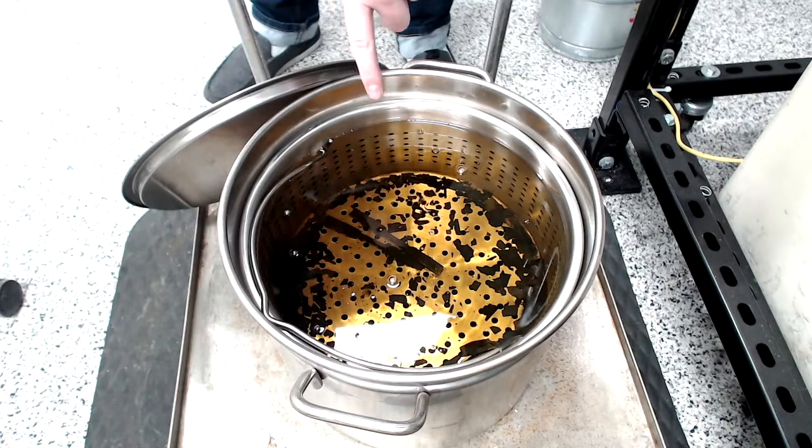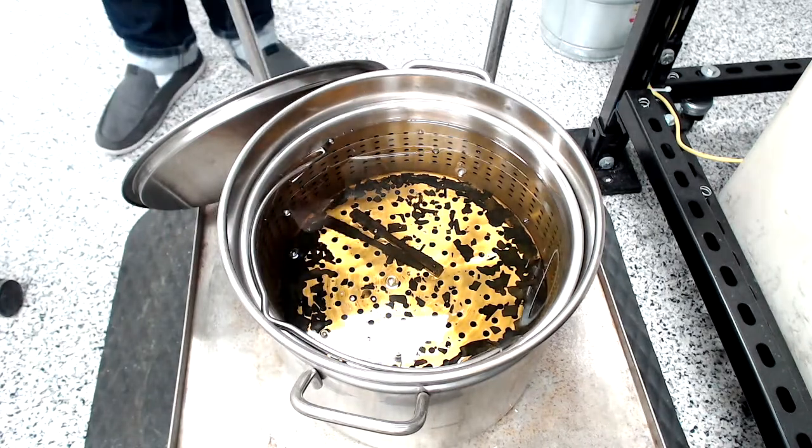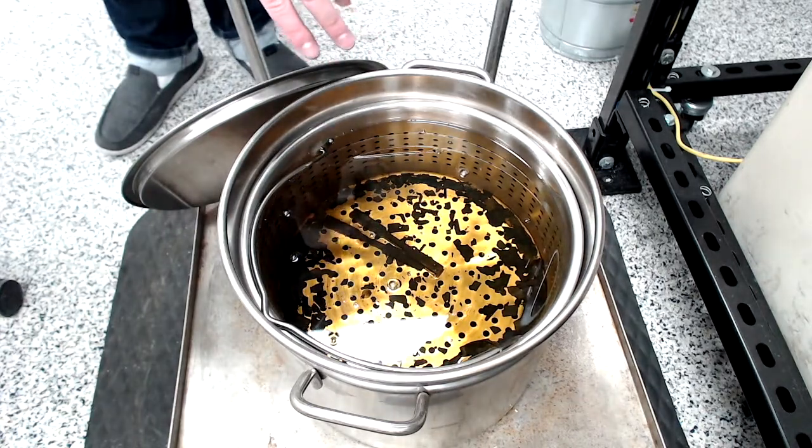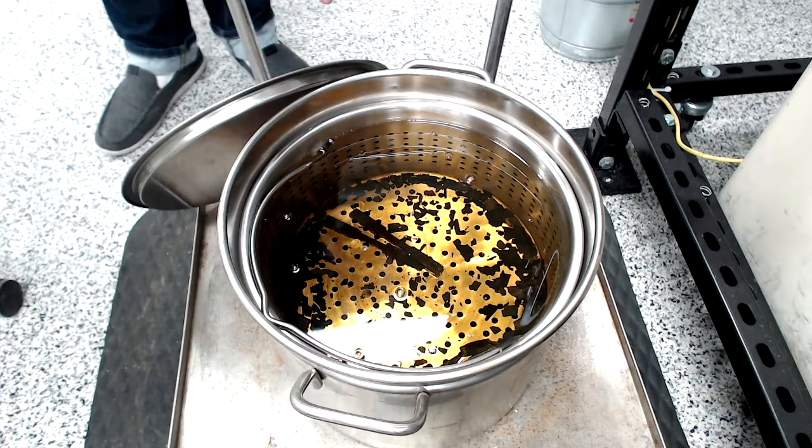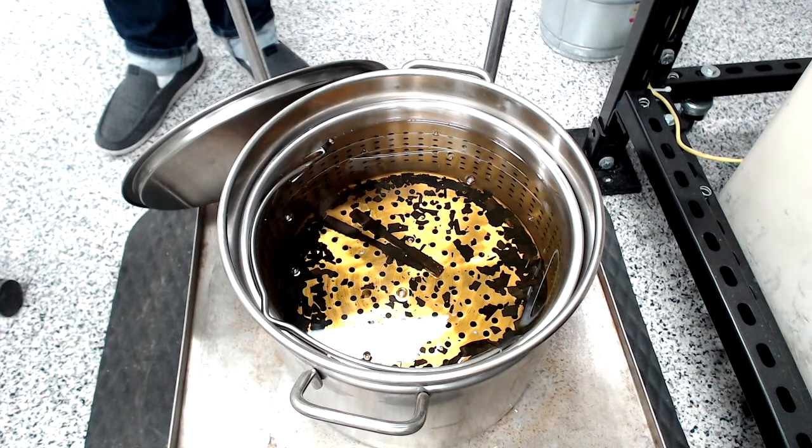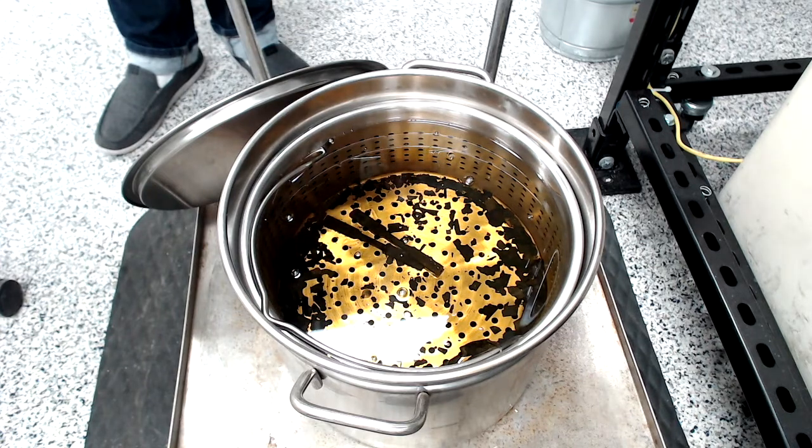All right. You might be able to tell when it stopped cooling. You can actually see the density changes in the oil come off from the very hot bar. And so, when those stop, the sample is cool. So, wait until that.